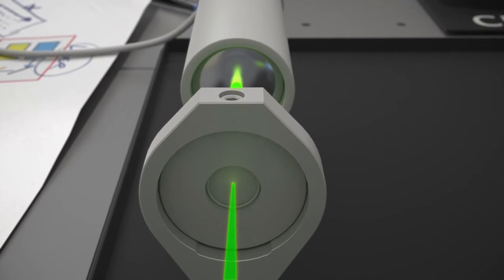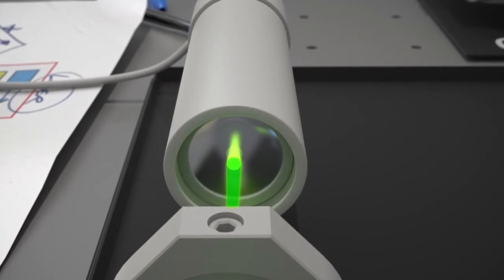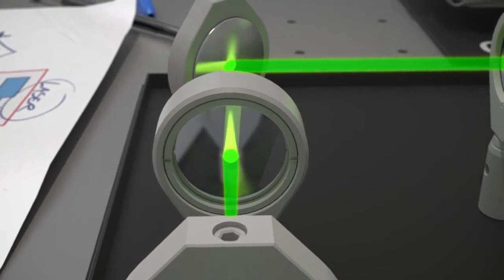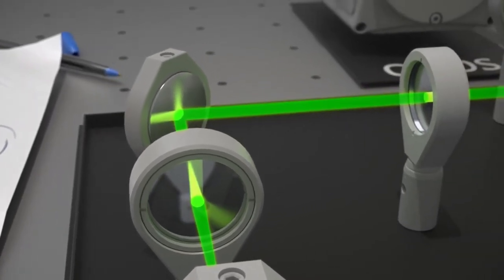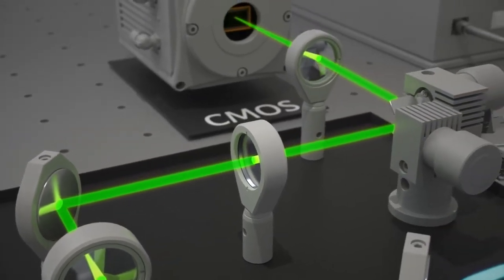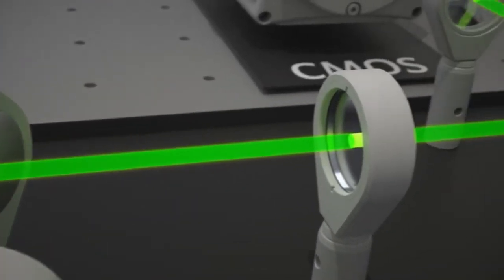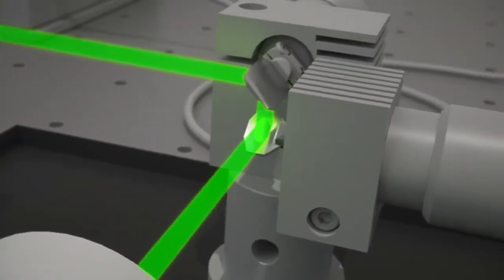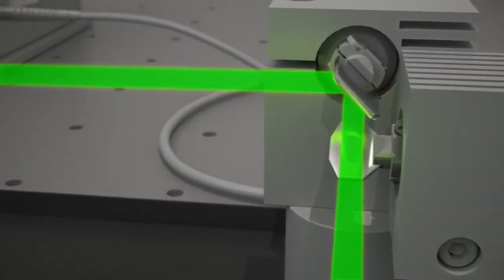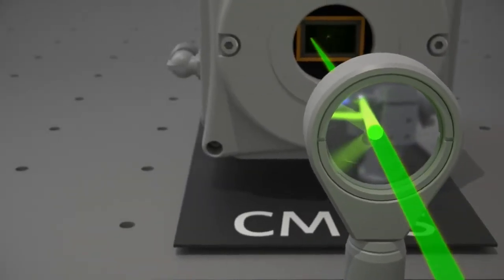So far, nothing special happened. The light path is the same as any other conventional confocal microscope. Traditionally, there would be a photomultiplier tube as a detector behind the pinhole. But the RCM adds a revolutionary optical detection system that improves resolution and sensitivity. After the pinhole, the emission light path goes on. The emission light is collimated again and hits the X and Y rescanning mirrors. The emission light is directed via the rescan scan lens to the camera chip.